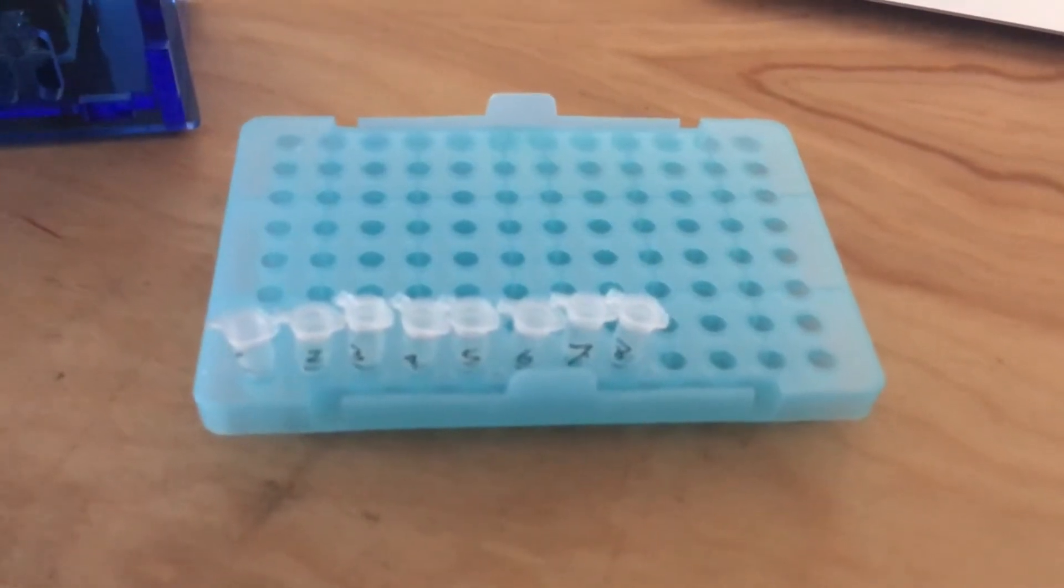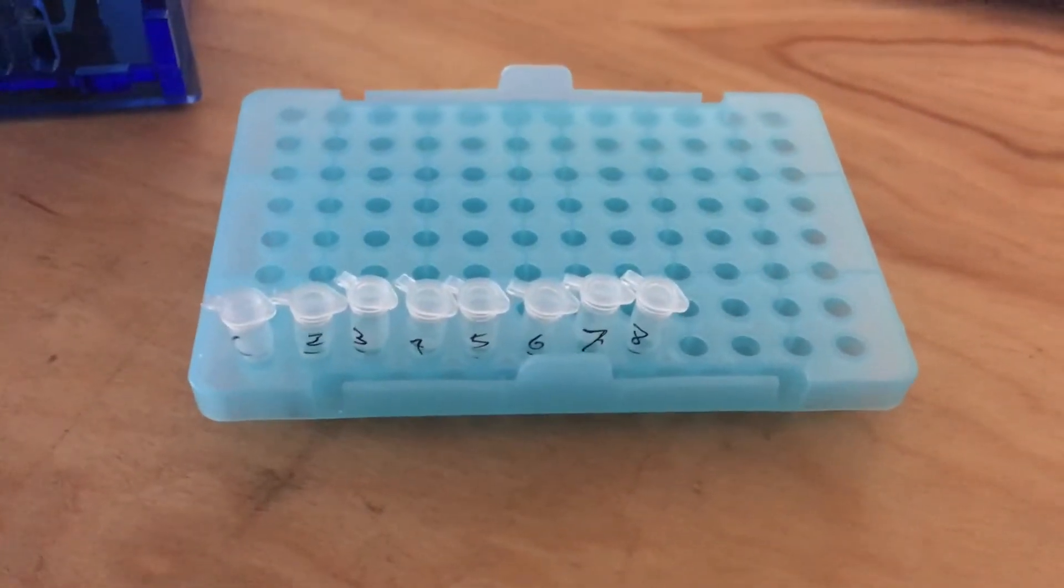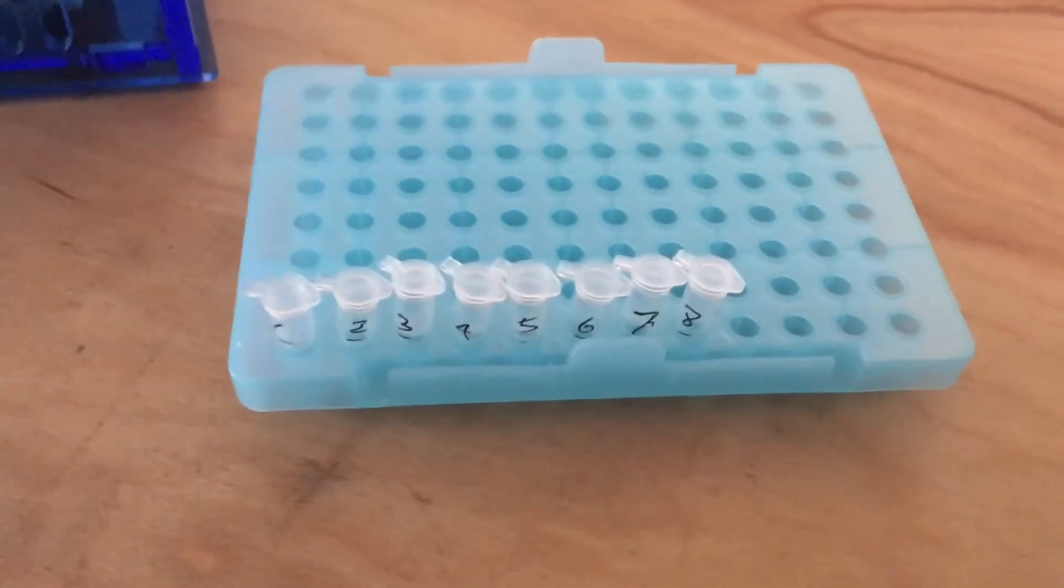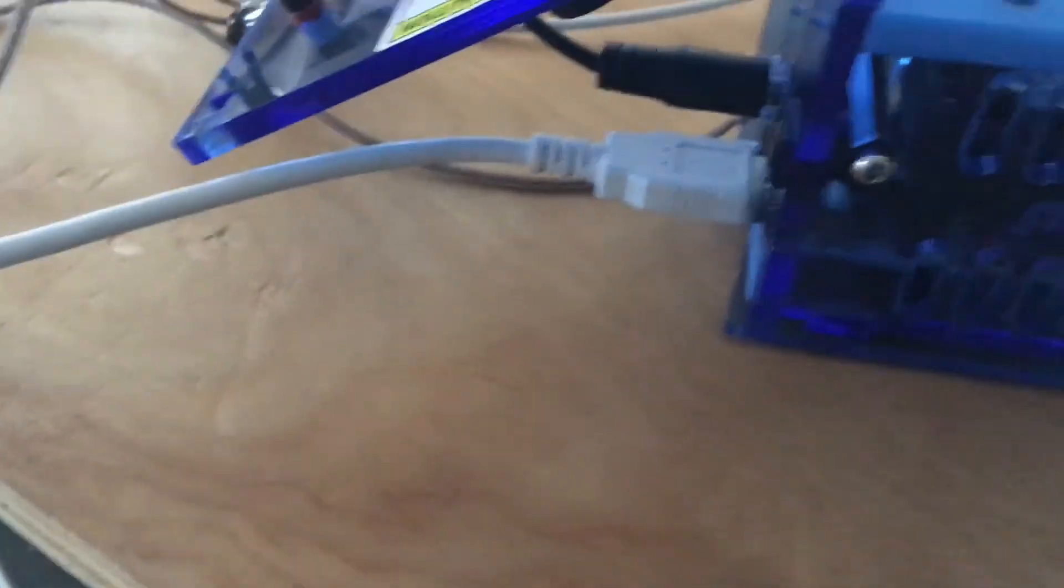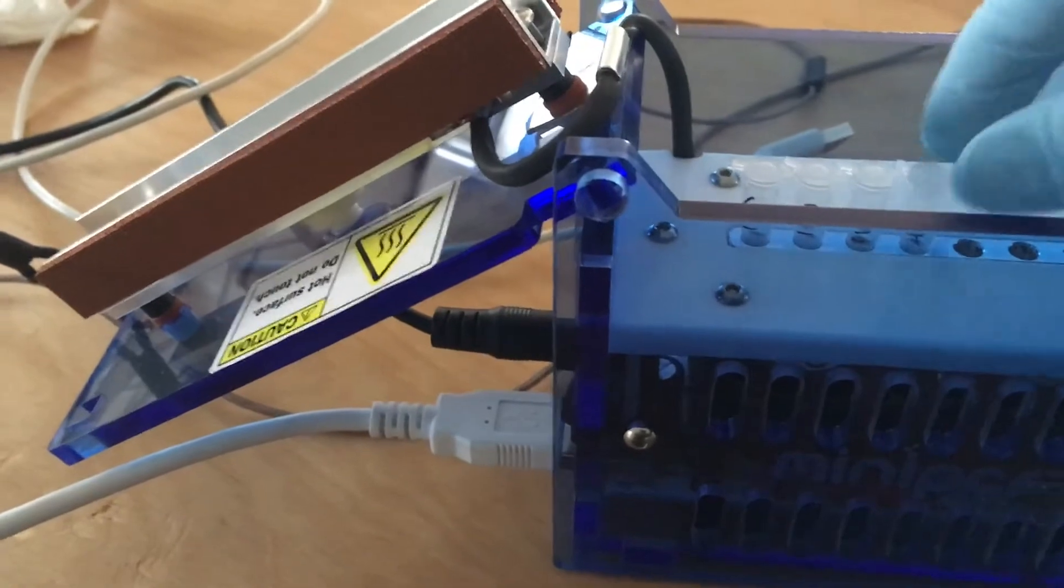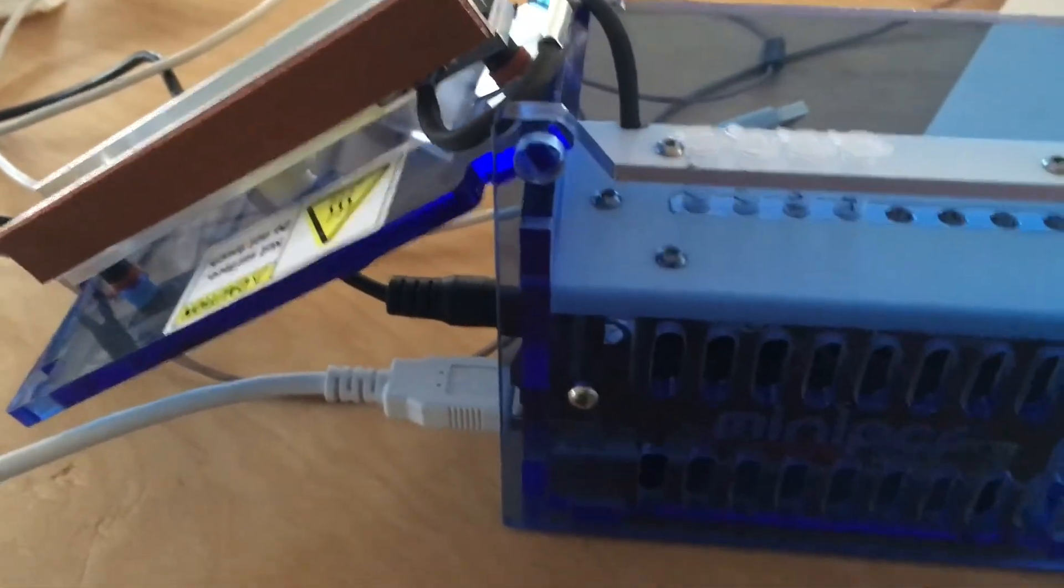So these samples are now ready for PCR, polymerase chain reaction. So we're going to pop them into our thermal cycler, making sure that the lids are tightly closed because they're going to sit in here for the next three hours.